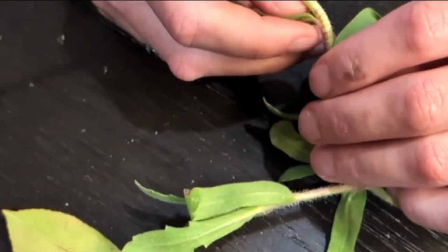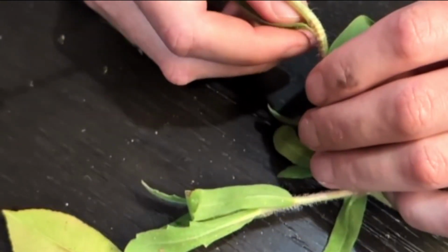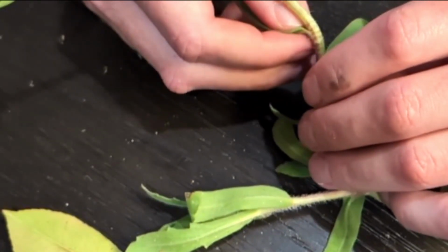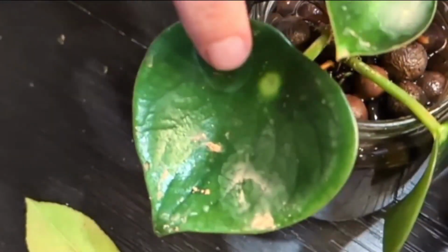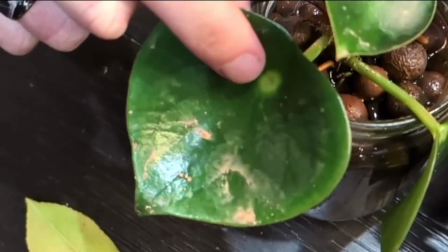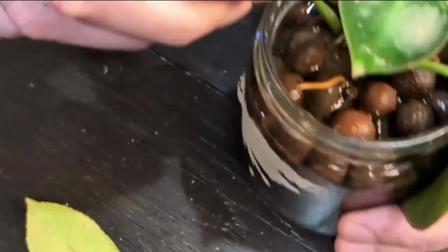You can kind of think of jade plants, the succulent. That's another one that verges on sessile. Sessile meaning that there is no petiole. They just go straight to the stem. That's a sessile leaf. We also have peltate. So here's a peperomia plant. And you can kind of see it already here. So here's the blade of the leaf. And right there, that little white dot is where the petiole attaches. So try and flip it over without breaking it here.